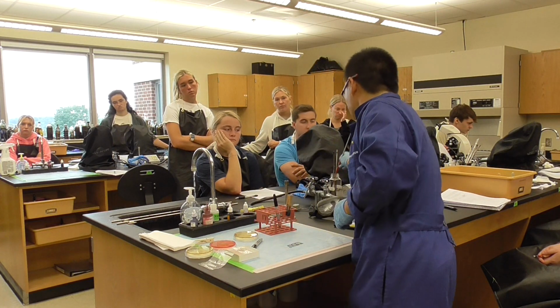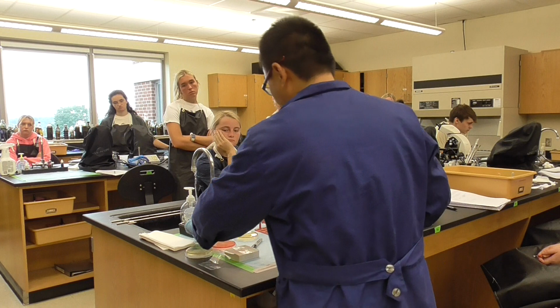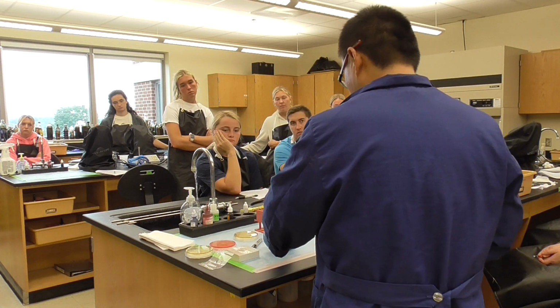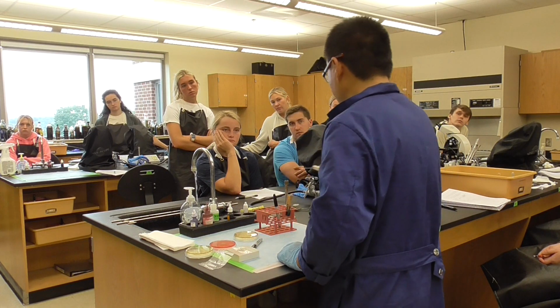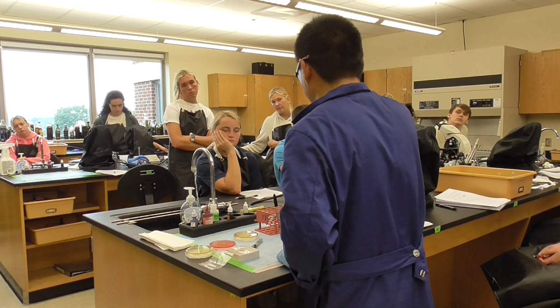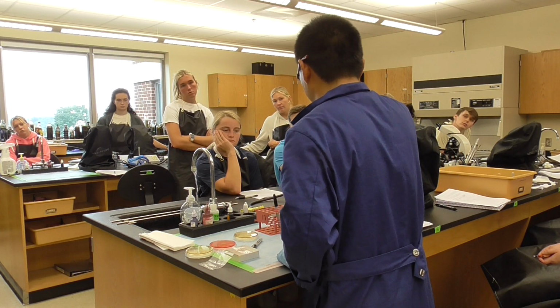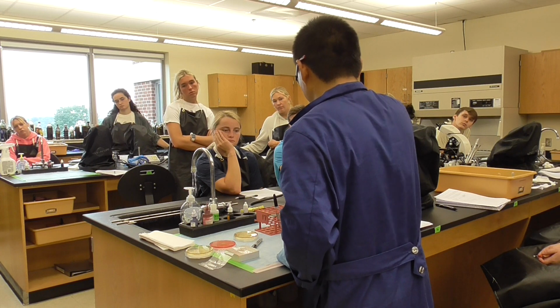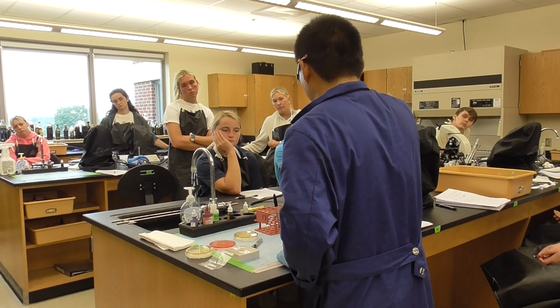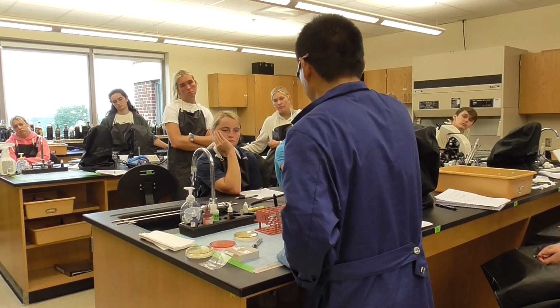So we're going to do sterilization of the loop first, and then we do the air dry. Air dry needs to take about 3 to 5 minutes. After that, we will do a heat fixing, going back and forth a couple of times. I'm just going to skip that and directly do the heat fixing. We'll see what it looks like. A couple of times. I said it's not cooking.